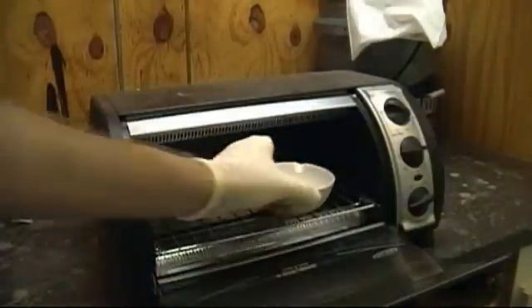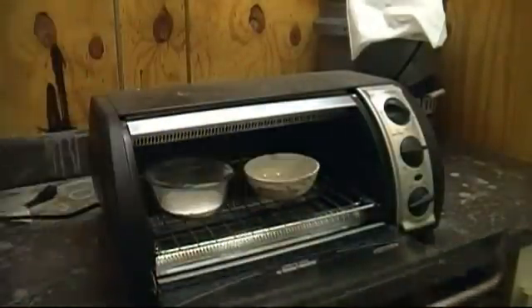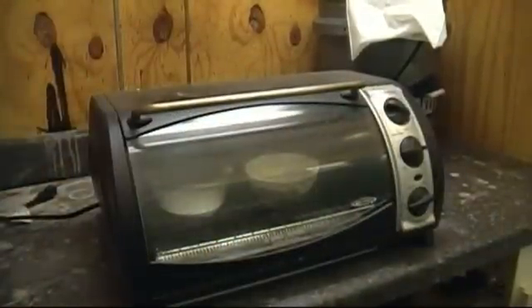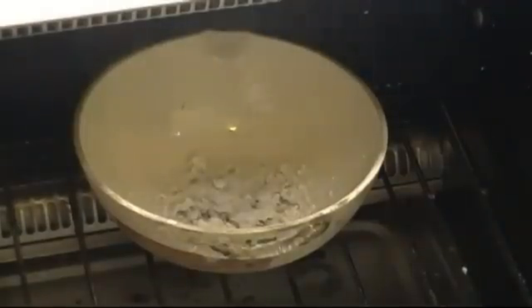Once all the material is in the dish, place it in a lab oven at about 200 degrees C. As it dries, it will go from a light gray color to a pure white color. Heating it to this temperature also appears to cause some small amount to decompose, although this could also be the sulfuric acid and water coming off. Either way, do this under a fume hood or outside.